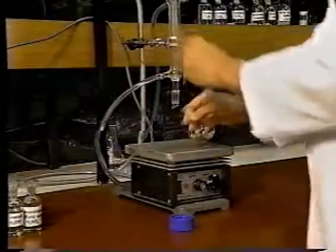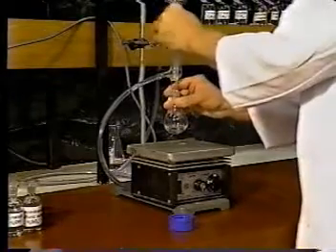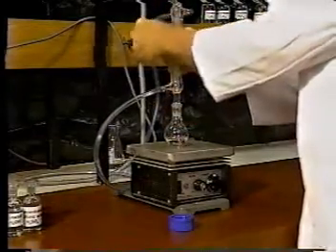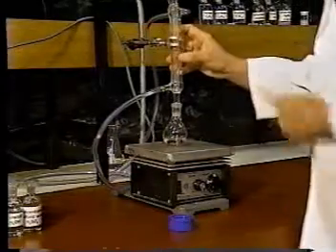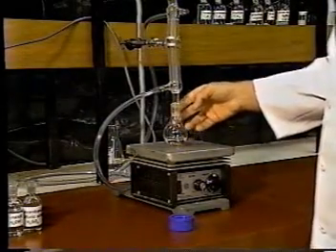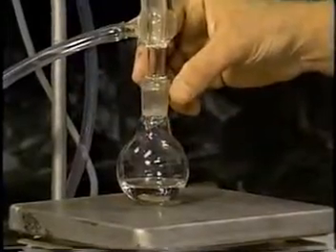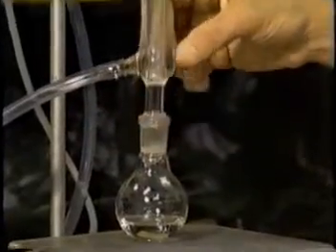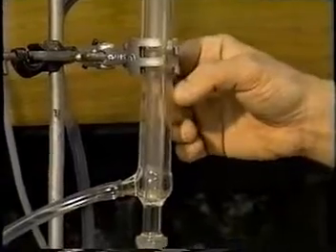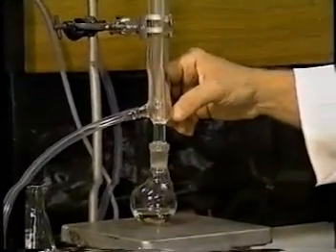Now we connect our flask to a reflux condenser and put it on a hot plate. The purpose of the reflux condenser is so that any volatile material that evaporates as it heats rises into the condenser, where it is cooled down and runs back into the flask — that way we don't lose any material.